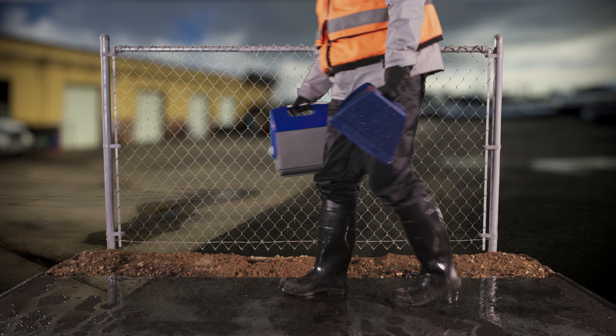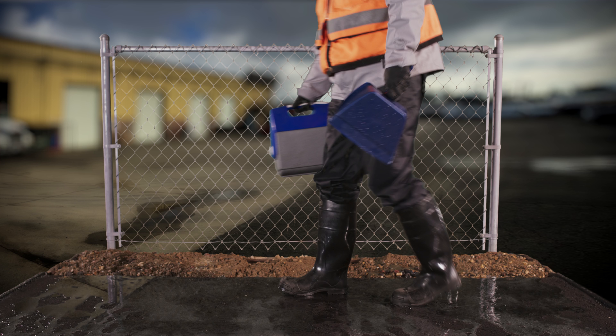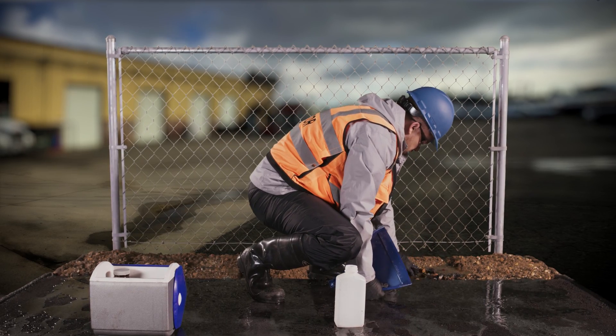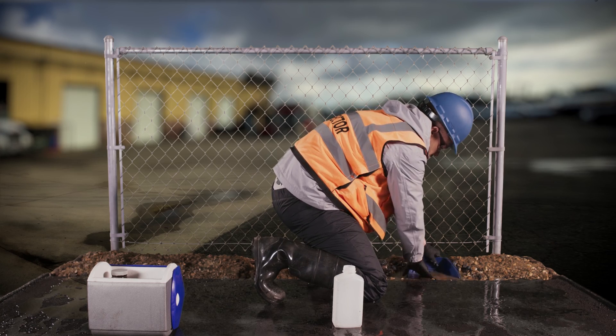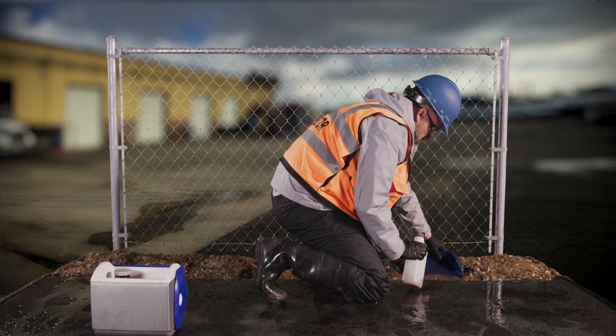If you're using automatic samplers, be aware they must be specifically designed to handle parameters like oil and grease and pH. Another problem is that the sampler is contaminating the stormwater sample by stepping in the water being sampled. The sample collector should always stand downstream or out of the water flow if possible. The sampler then digs a hole in the nearby gravel and uses his dustpan to collect the water — but the sediment disturbed by digging ends up in his sample, which is not representative of what was flowing off the site.